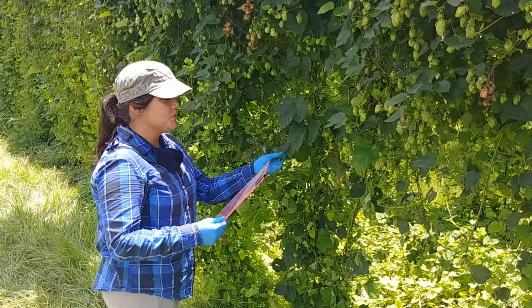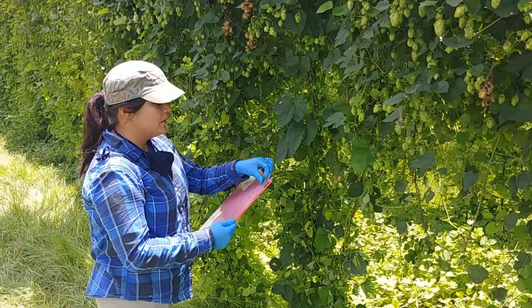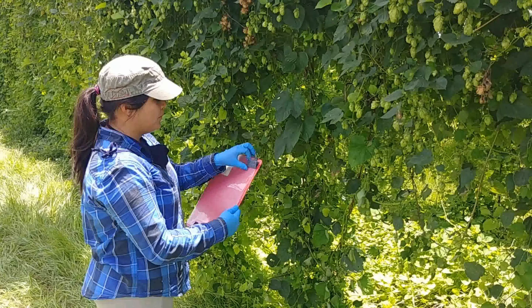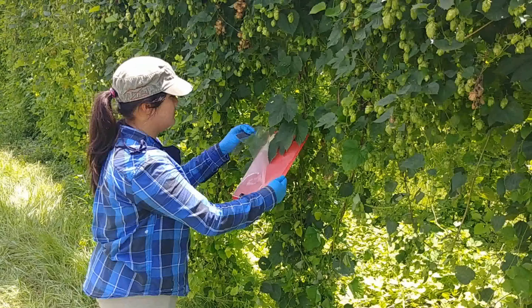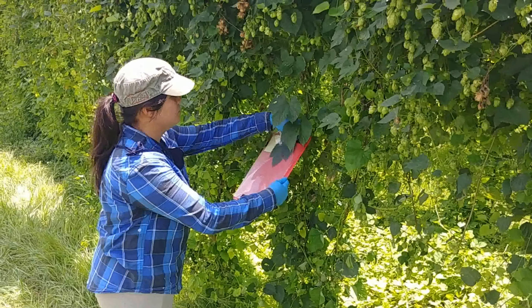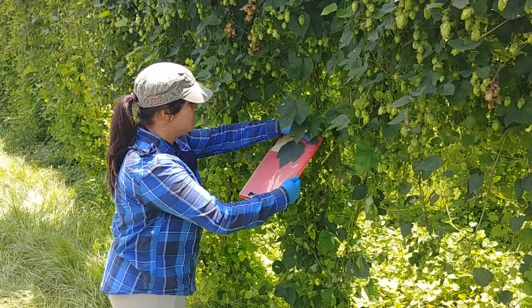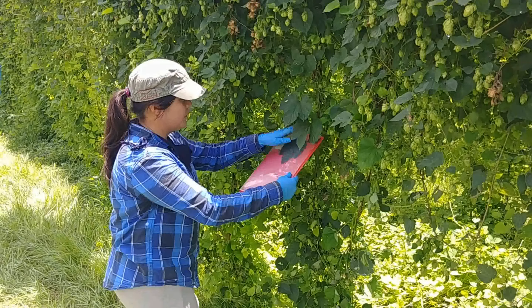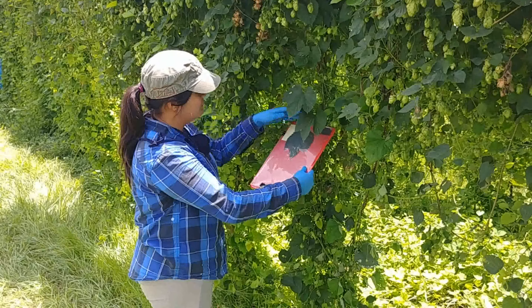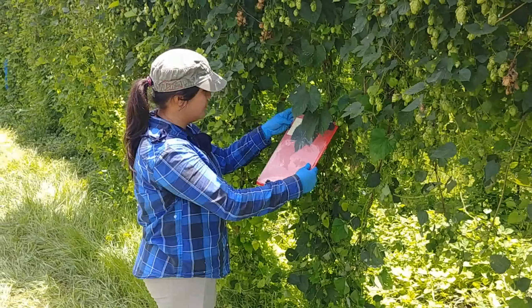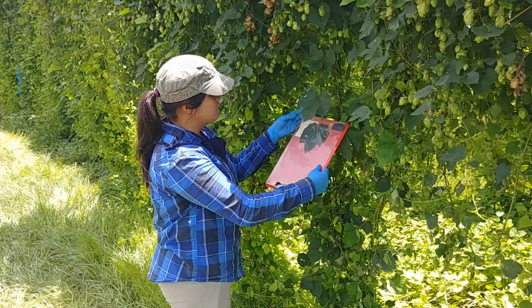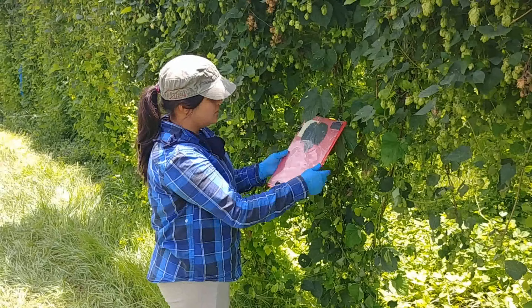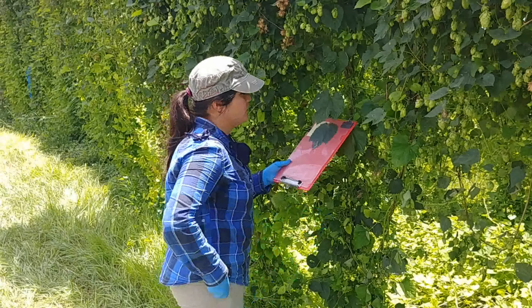So, after you choose the leaf that you are going to measure, you need to open the magnet and place the leaf inside the plastic here. Be sure that there is no folding, that the post-it is visible, and the leaf is not covering any part. This is ready for the picture.